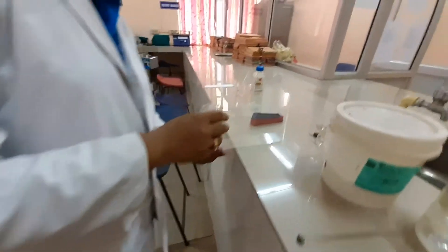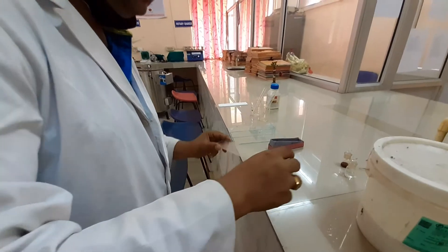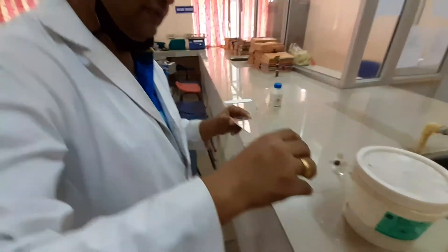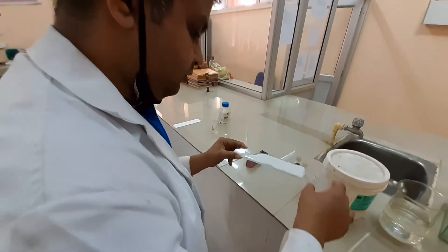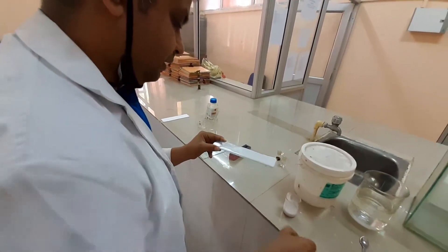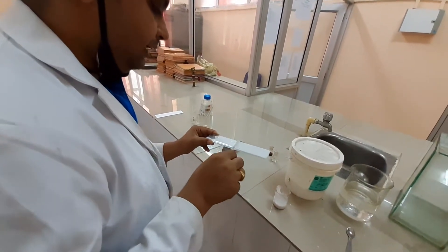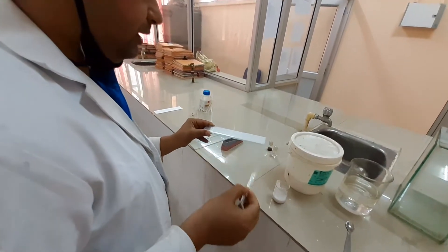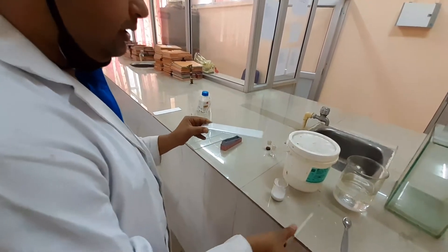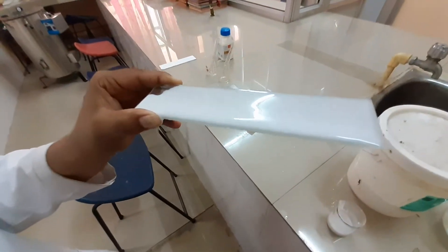This slurry we slowly have to put in this fashion. What we are doing here is making a thin bed of silica gel over a glass plate. This is the preparation of the silica gel plate.